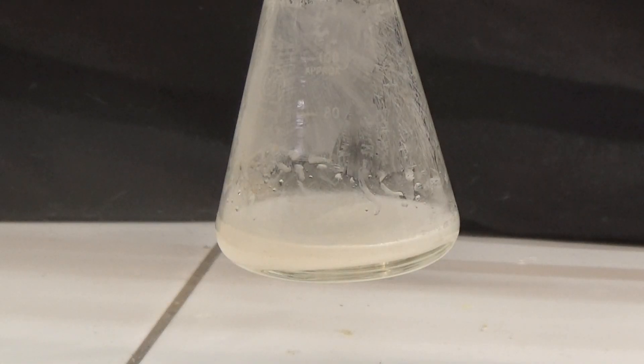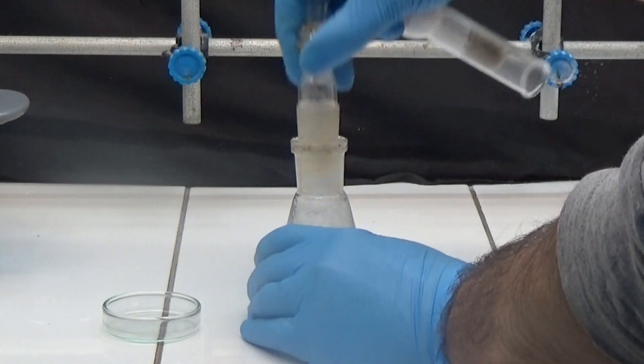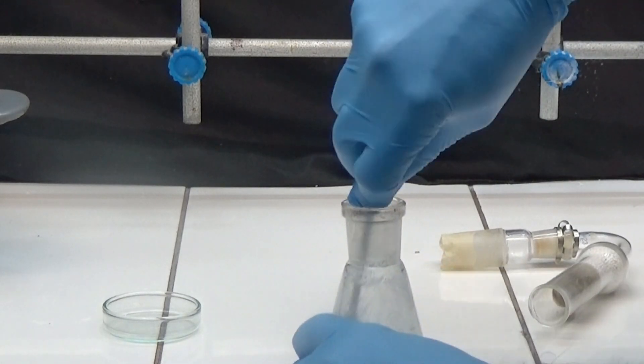The anhydride remains solidified at the bottom of the flask when it gets cold. By scraping off a small portion of the solid, we can determine its melting point.